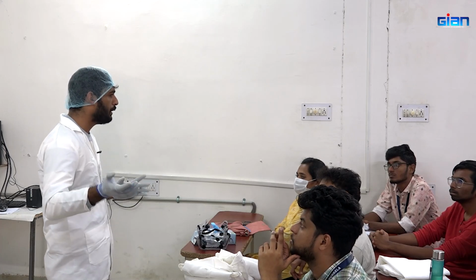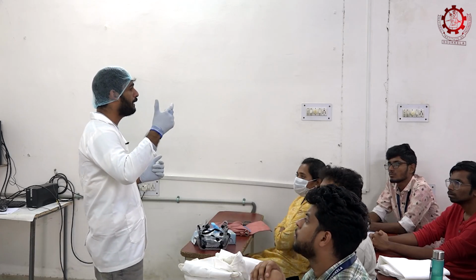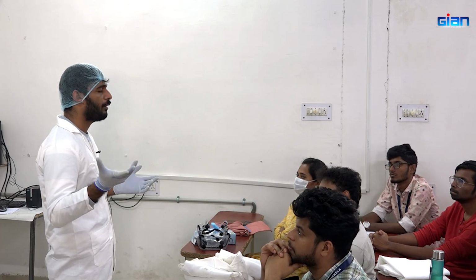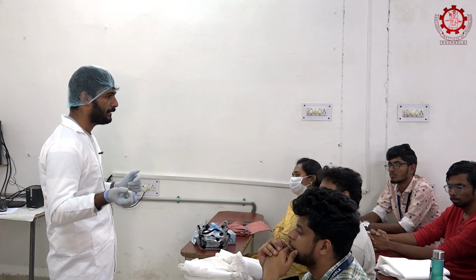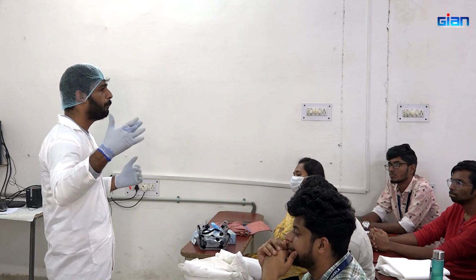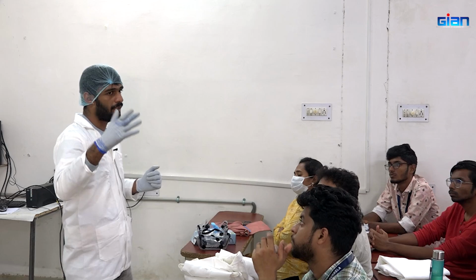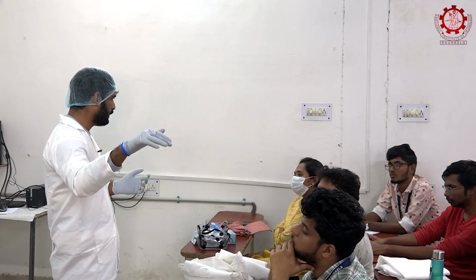In acidic pH, every color with a different chroma factor varies according to the pH, in the presence of H+ and OH- ions. You might know about anthocyanin. It varies its color with respect to pH, right? From blue to purple. That wide range of color or chroma is there in the presence of hydrogen ion concentration. Similarly, astaxanthin shows this brownish color in the presence of acidic pH, and this pigment also dissolved in the fraction.